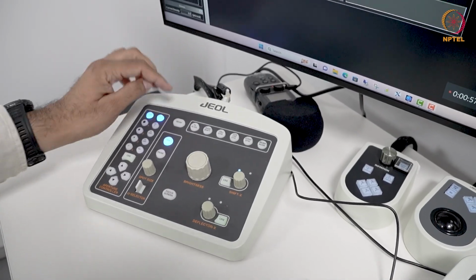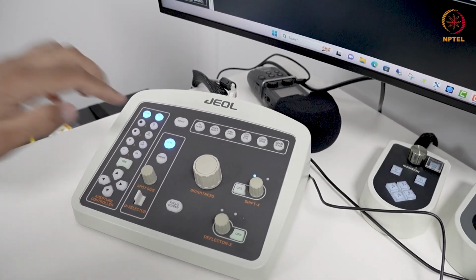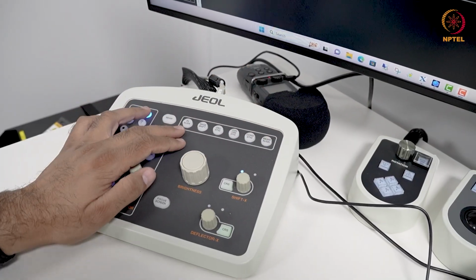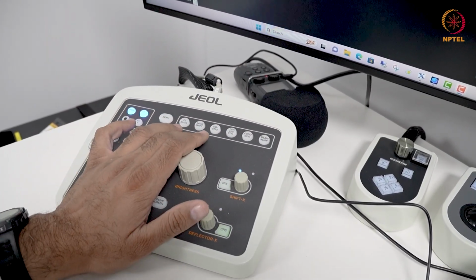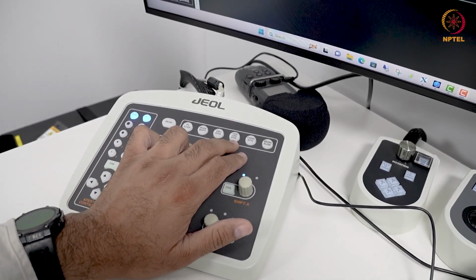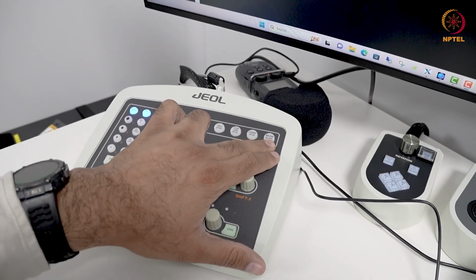Now here is, once you switch on the emission, the beam control valve. So you press this, your column valves are actually opened when I press this. Here you have all the alignment knobs. You have the PL alignment knob here. You have the image shift. This is for objective stigmation, coarse corrector setting, stigmation, condenser stigmation, and beam align.